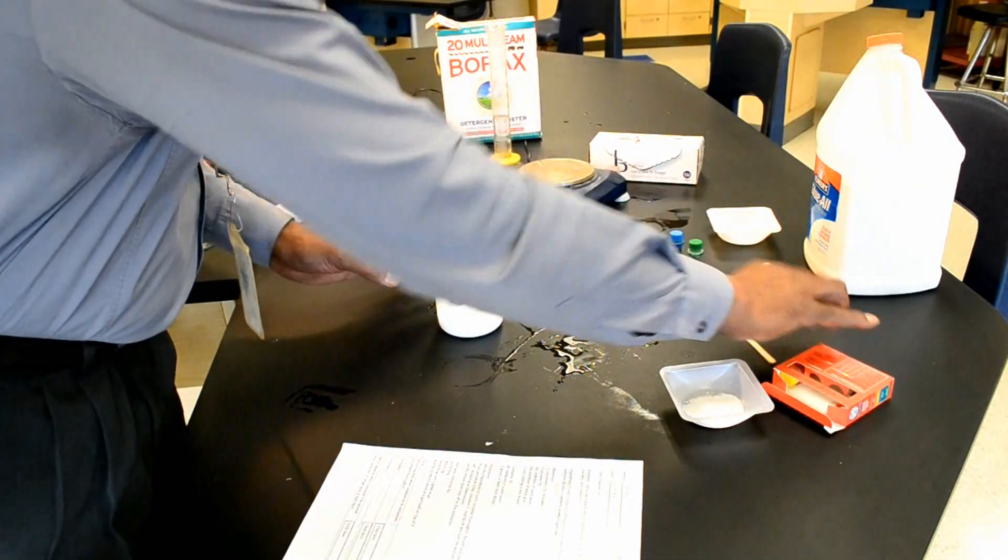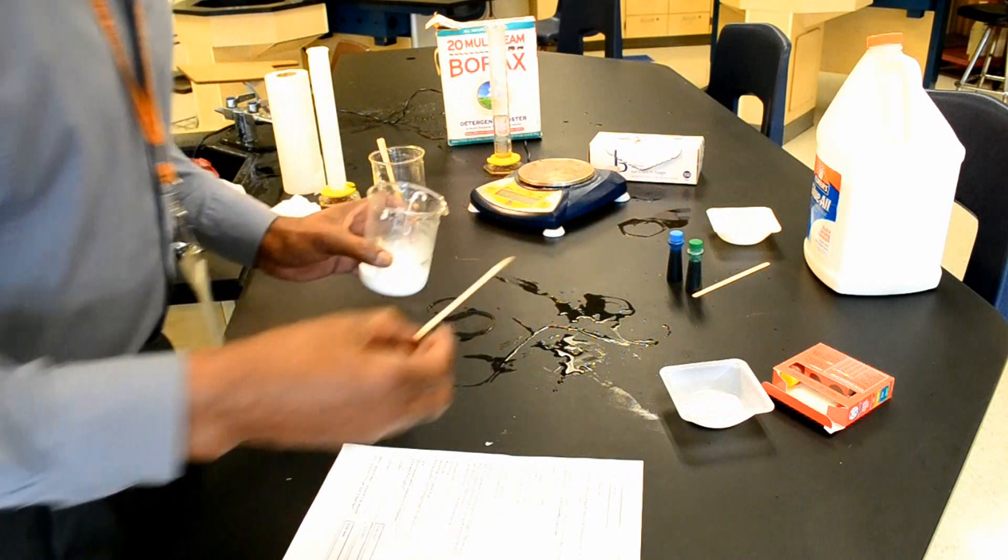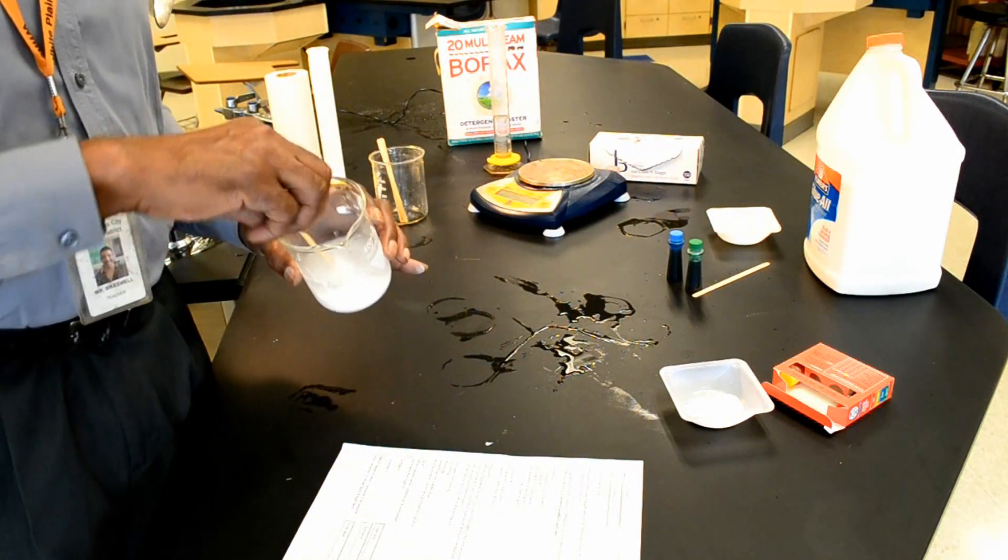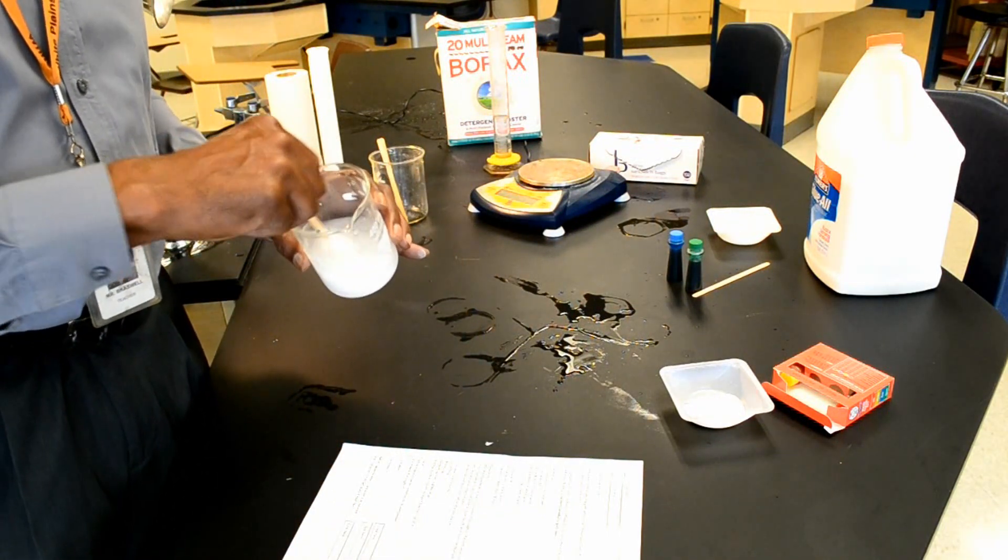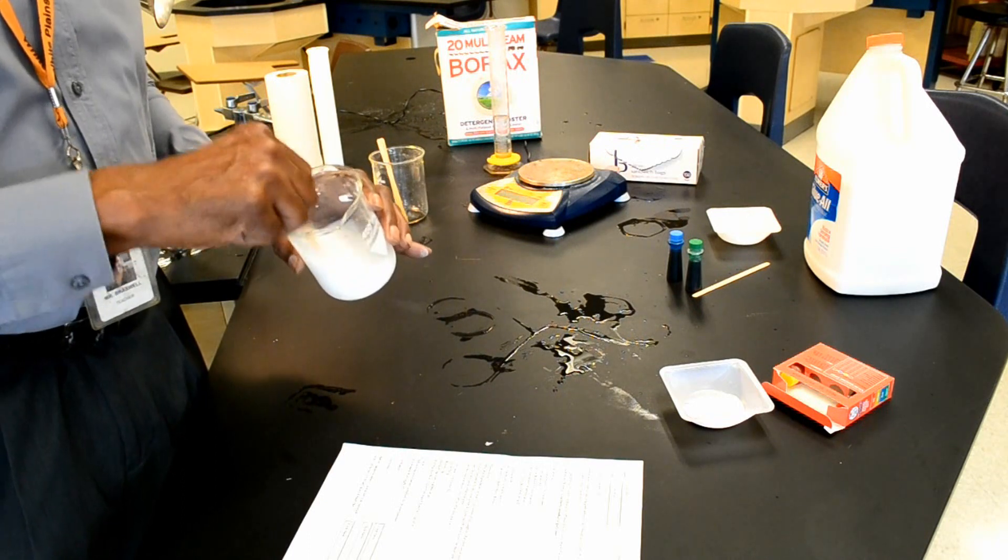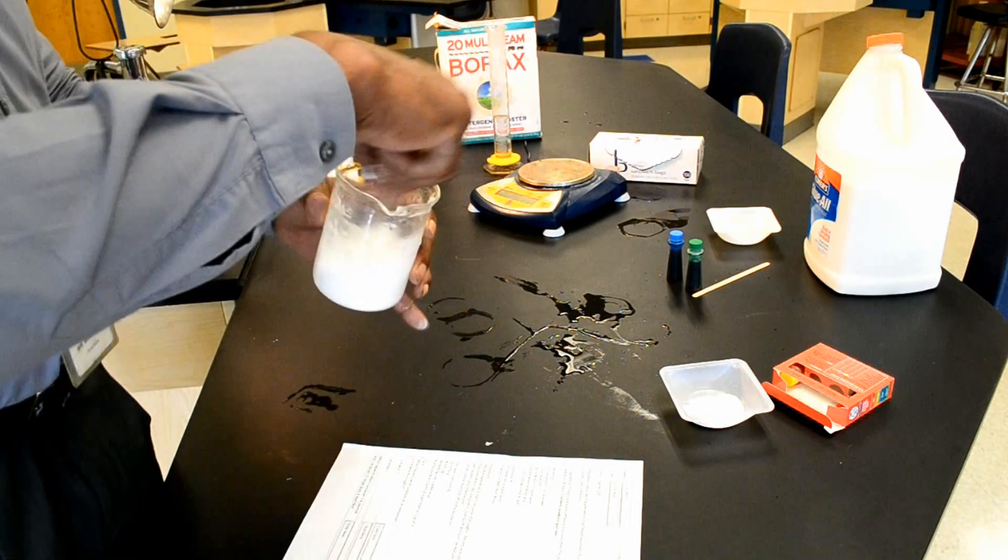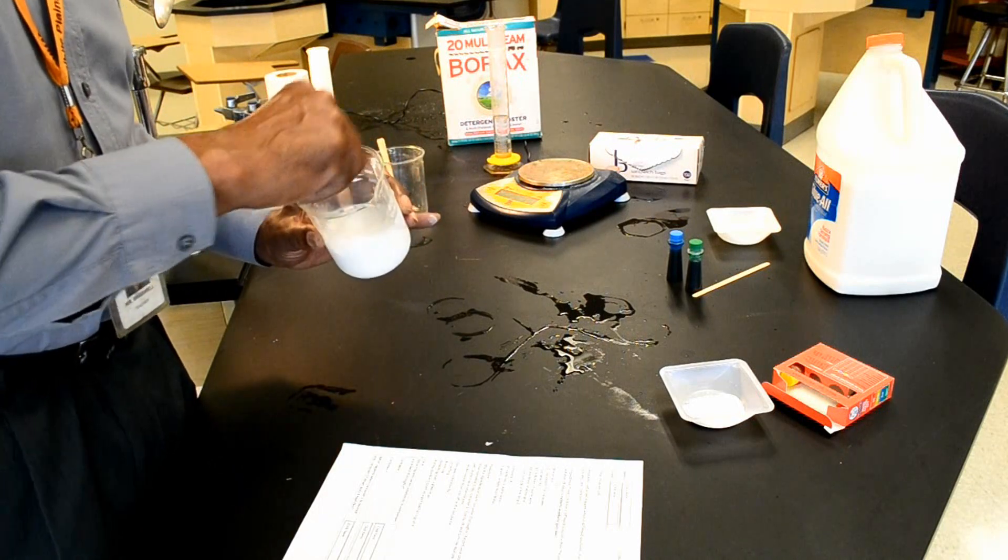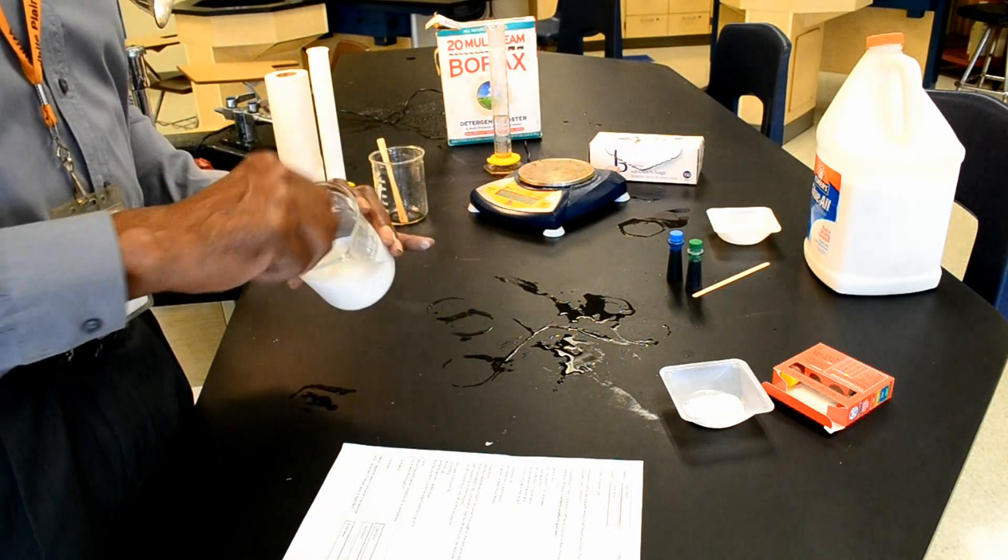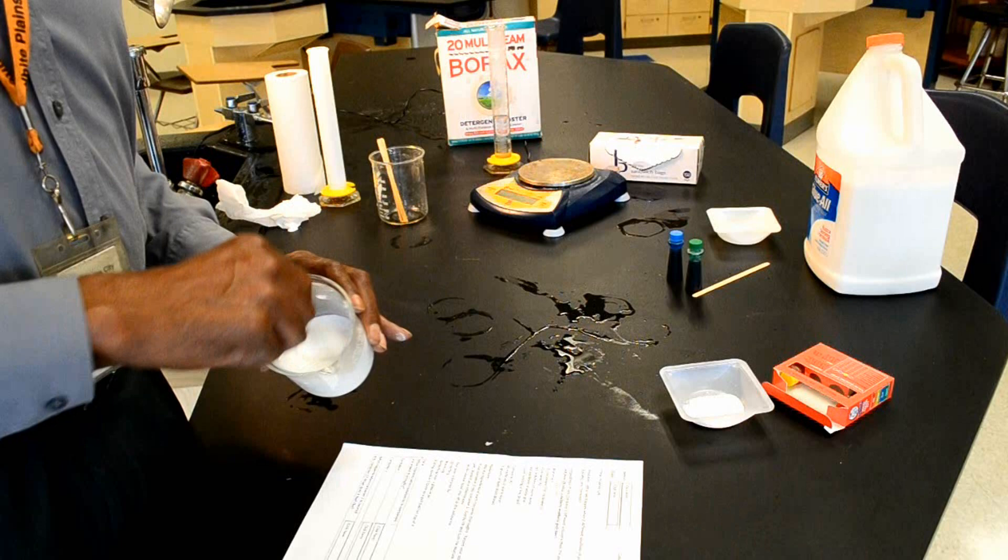Now I'm going to take a wooden splint and stir the mixture together, which is going to form what's called a homogeneous mixture, which is also called a solution.